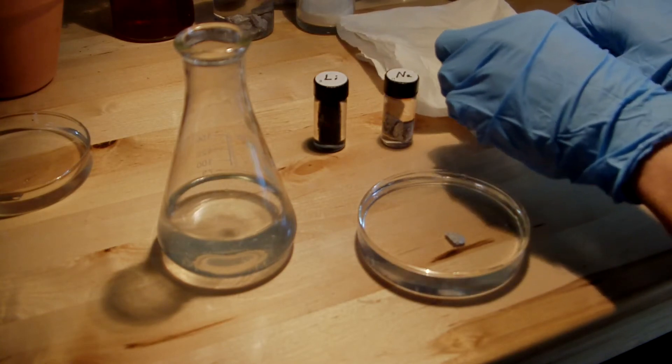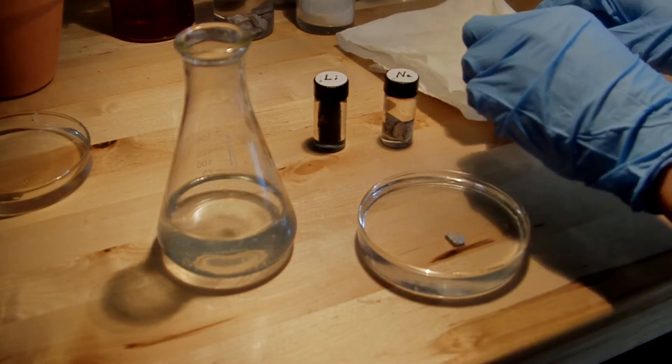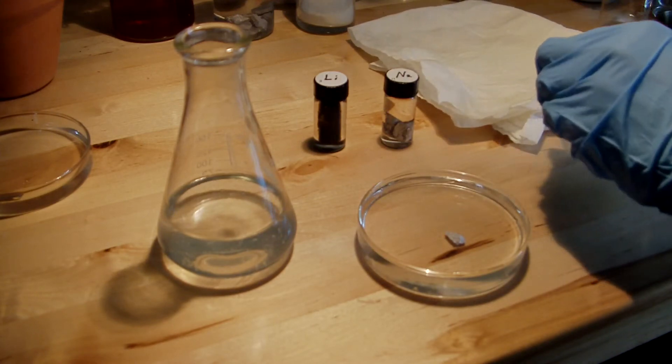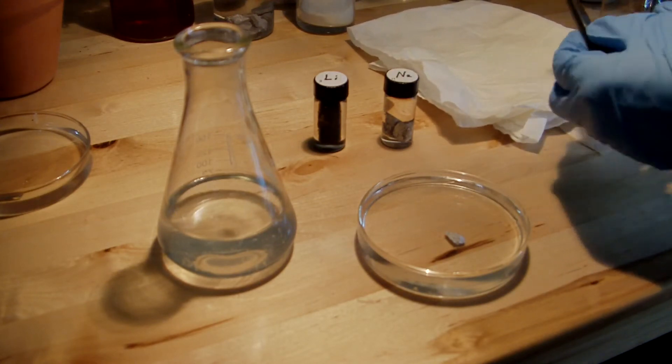So my lithium was left out a little bit longer than it should have been. So you can see that it has this dark hydroxide coating on it.